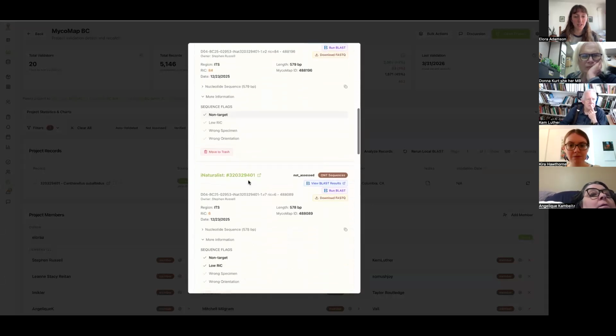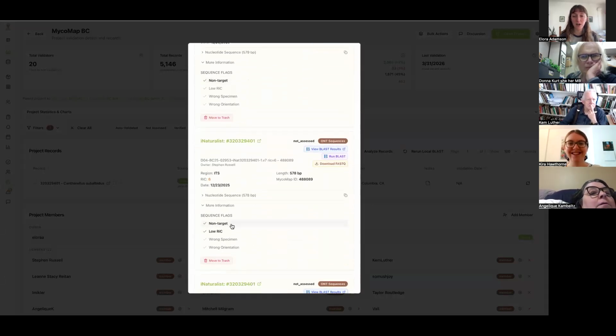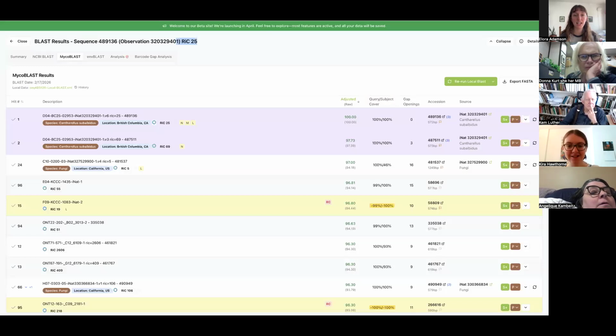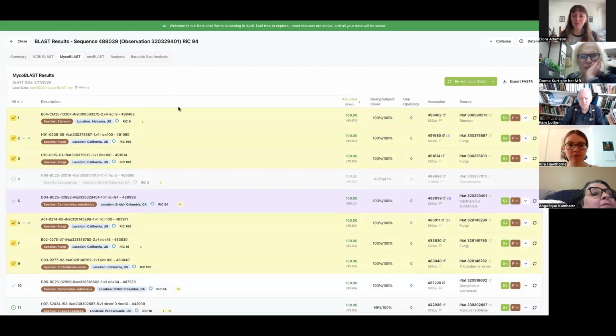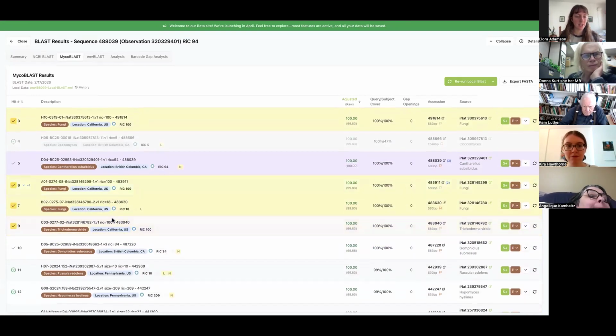So our next one, 6 reads. It's already been marked as non-target. I'm just checking that it's doing what it's supposed to at this point. Some of these look like they're multiple purples if you scroll slowly. That's because we have nine sequences. Any of ours that match each other will come up in each other's blast searches, and they'll both be purple. Yeah, good catch.